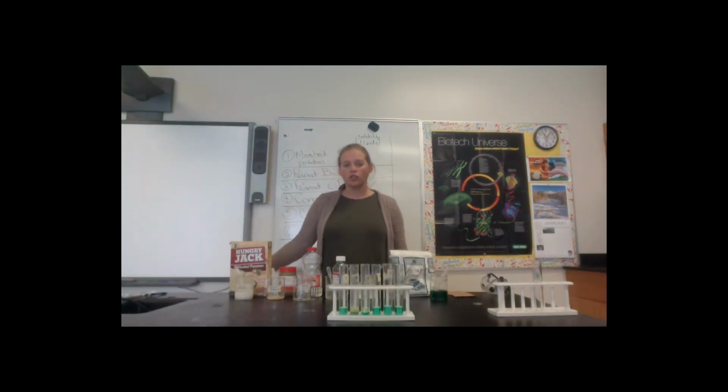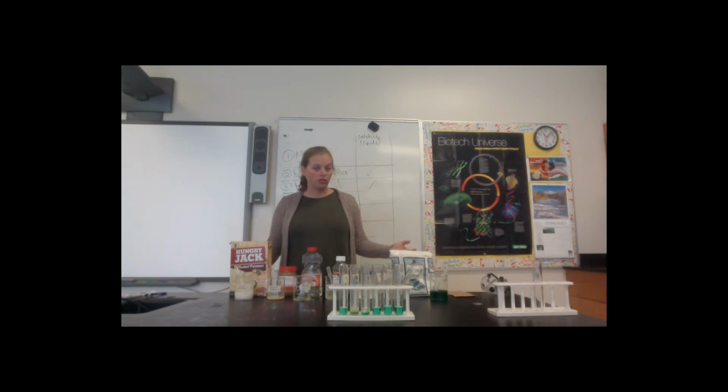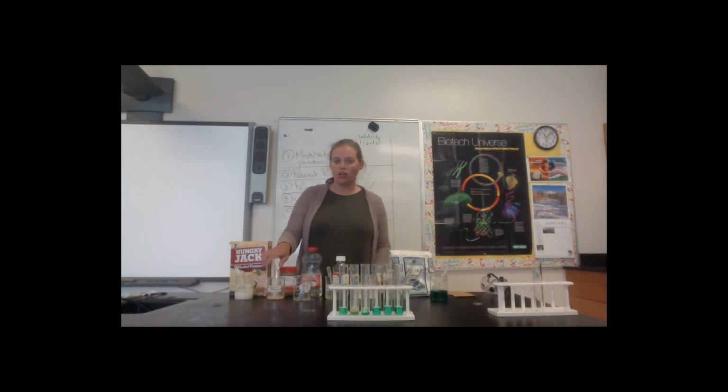When we think about why the solubility test works, it comes down to the structure of water itself. Water molecules are polar, which means they have charges on each end, and those charges interact with each other to pull those water molecules really tightly together. It's why you see water bead up on your car windows and things when it rains. So if we're thinking about polar substances, they will dissolve other polar substances. And nonpolar substances that don't have charges at each end of their molecules will dissolve other nonpolar substances, like fats. That's why I had to use alcohol, a nonpolar substance, to dissolve my peanut butter.